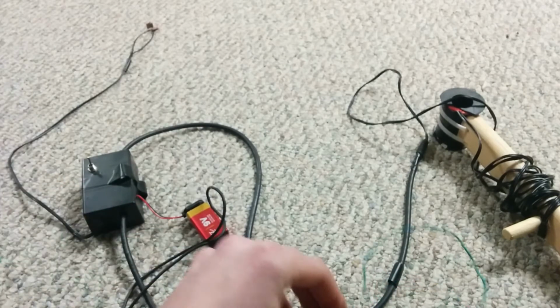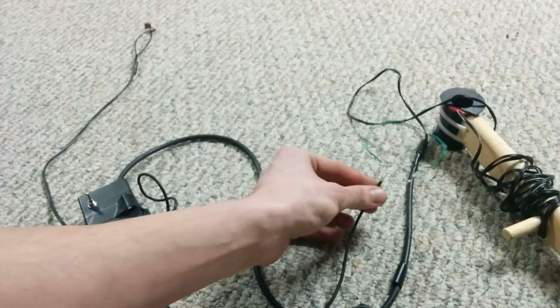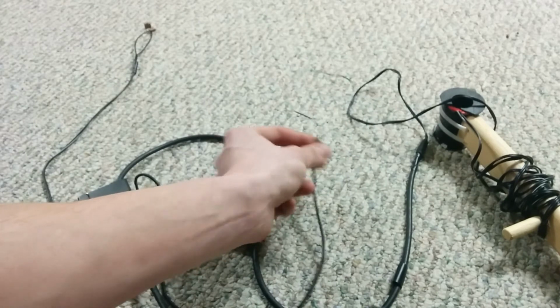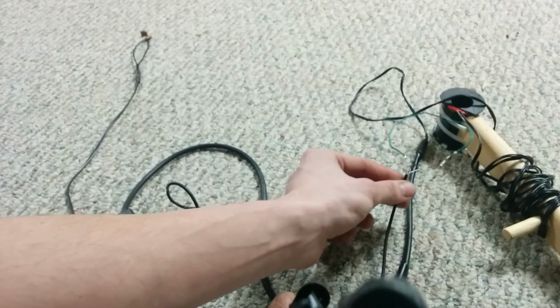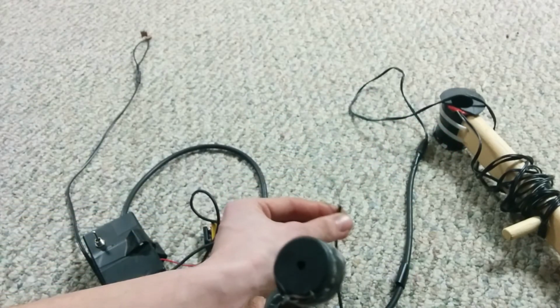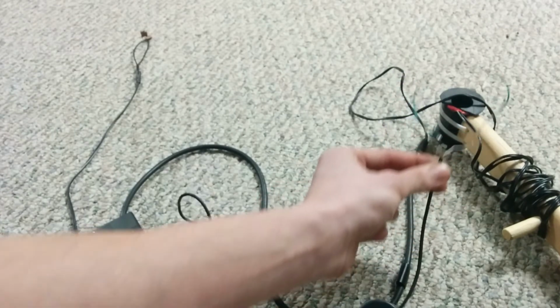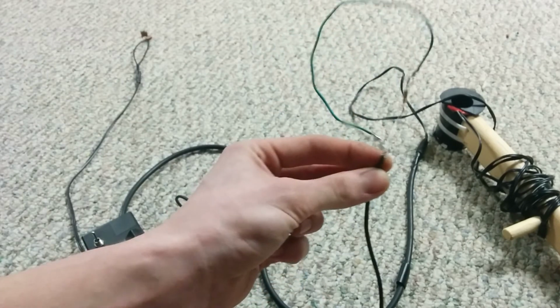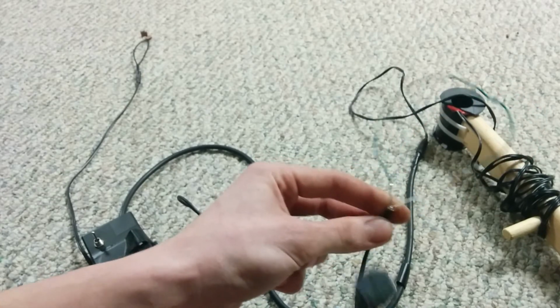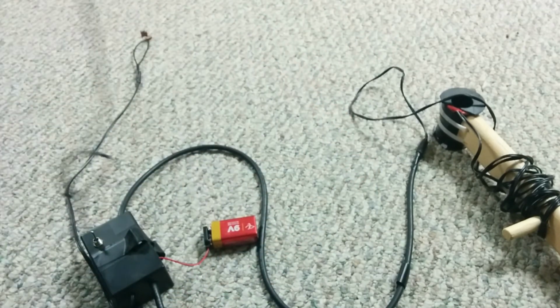And this is as quiet as my phone goes. So it's probably a few tens of millivolts to one turn through a 10K. See, it's driving into saturation. I don't think this is coupled to the camera very well, but if it was, you could hear it out here. So anyways, that gives you an idea of the kind of test you can do to see if you're in the right ballpark of sensitivity. It depends on how you're outputting it, right? I've gone to USB sound cards, and you don't need that kind of output depending on what you're doing. So that's that.